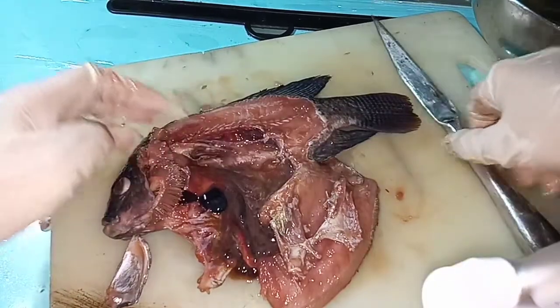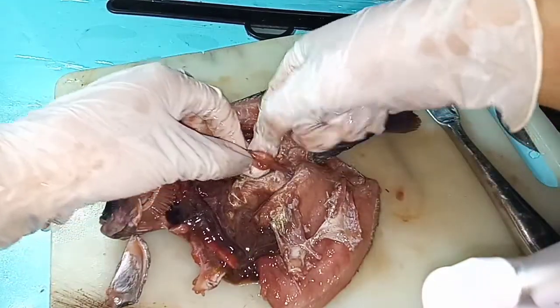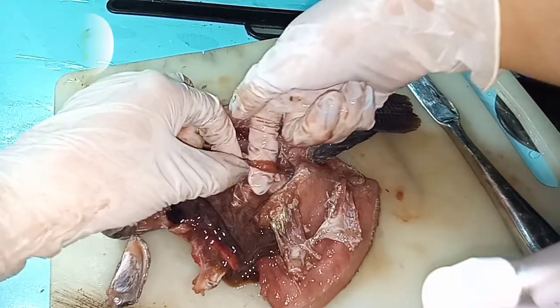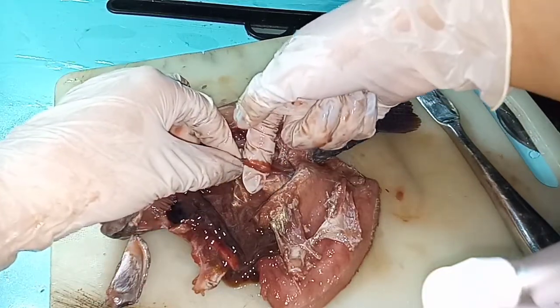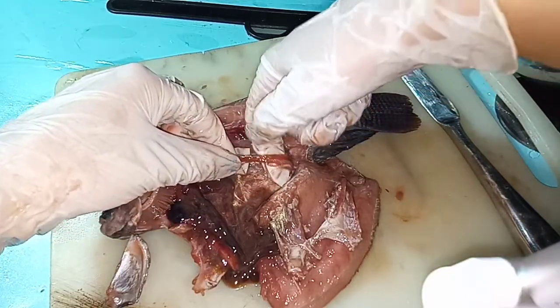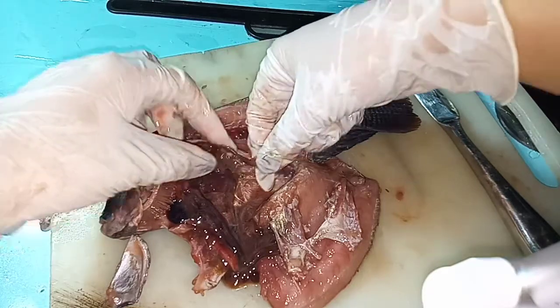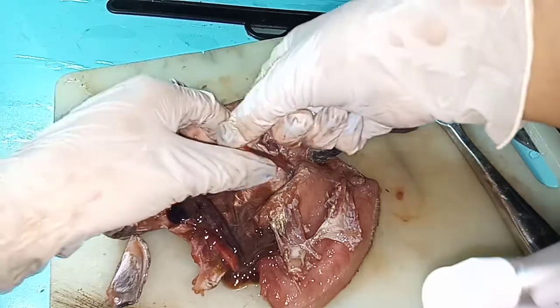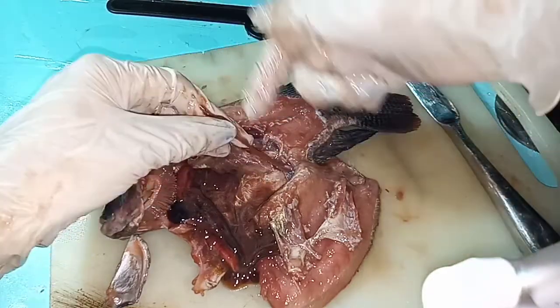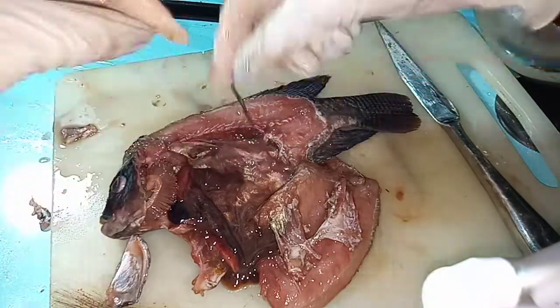Then, we're going to find the vent. For the vent, we could see this is the vent. It is actually connected to the anus — from the word itself, 'vent' — this is where the food is vented out.